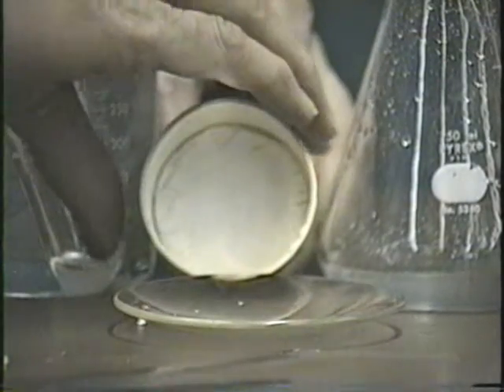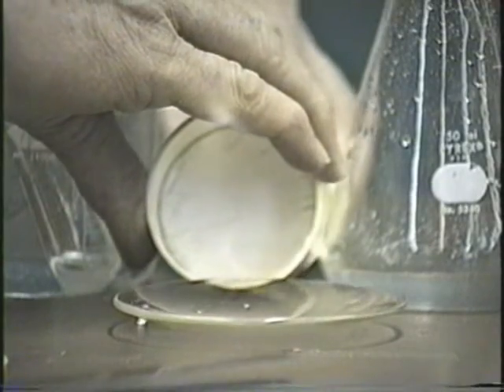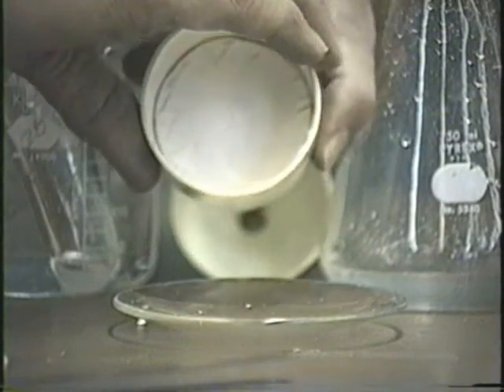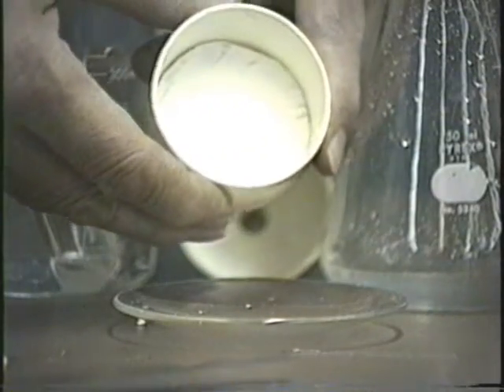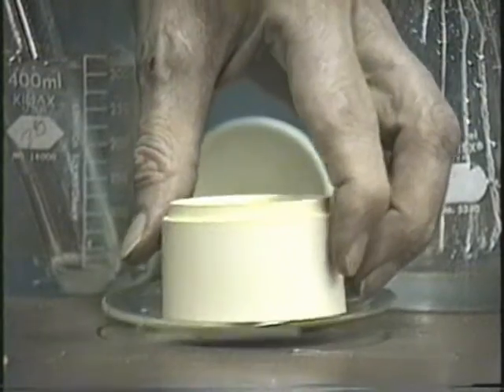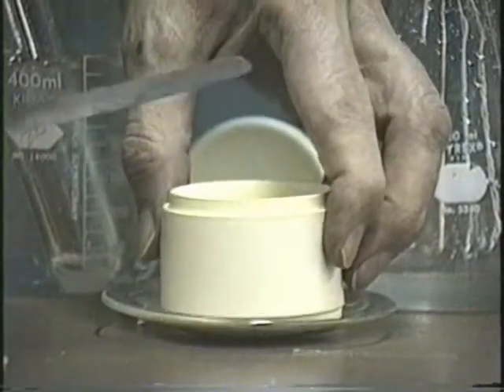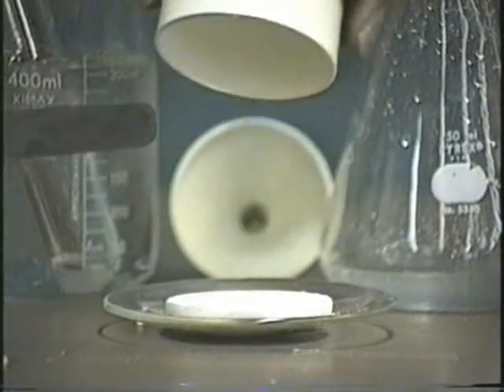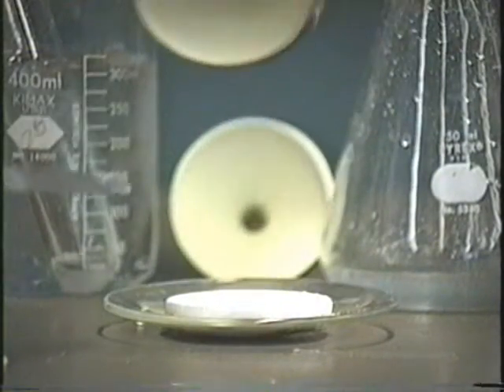To do that, what you usually do is break apart the Buchner funnel here. They come apart, that is, don't break it. And put it on the watch glass. To do that, just put this down here. Now, if it doesn't come out, this came out automatically, but if it doesn't come out, just take something and tap it a little bit. It usually falls out. If not, you may have to dig it out.